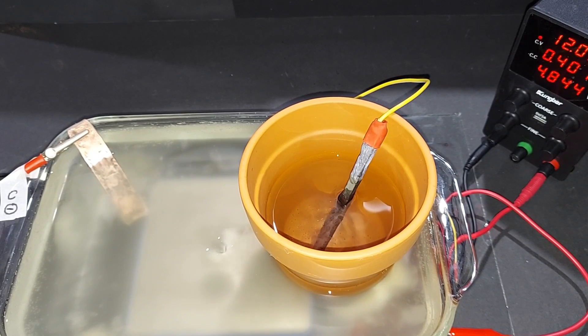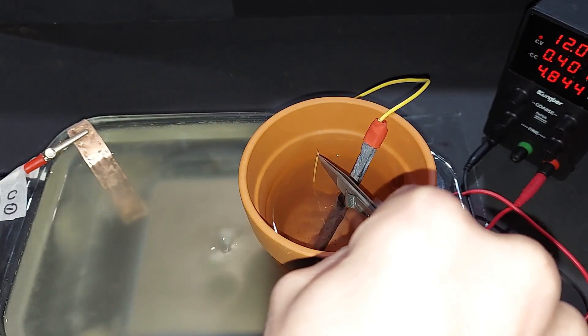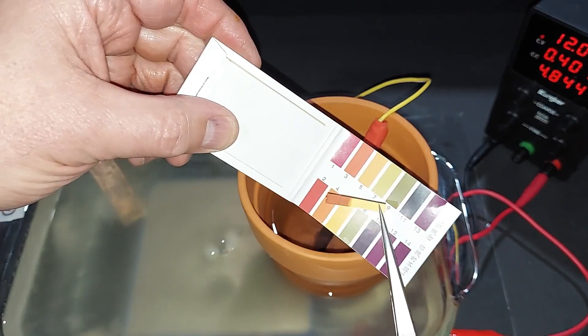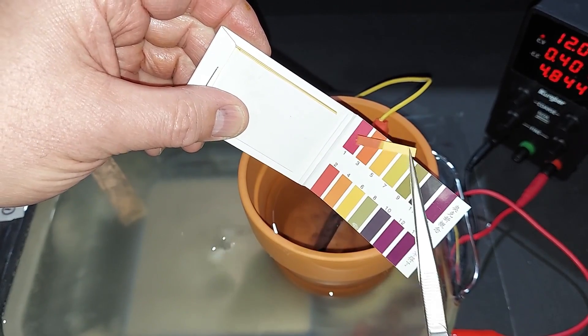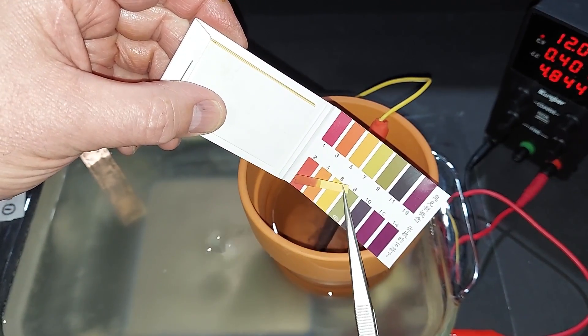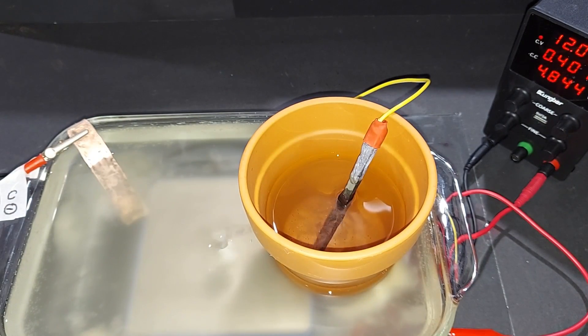We're five hours out, and neither the amperage nor the wattage has changed. The voltage has been the same the entire time. Checking the pH—it's still really close to a 2, hasn't darkened to 1. That would be very difficult with this experiment, so it's at about a 2. I'll leave it for another half hour and then turn everything down.